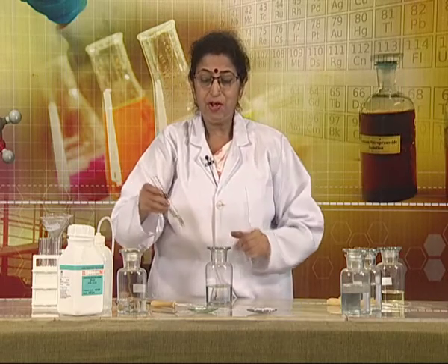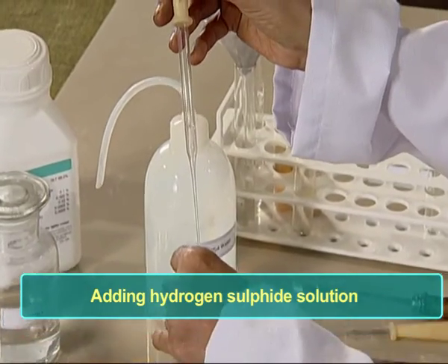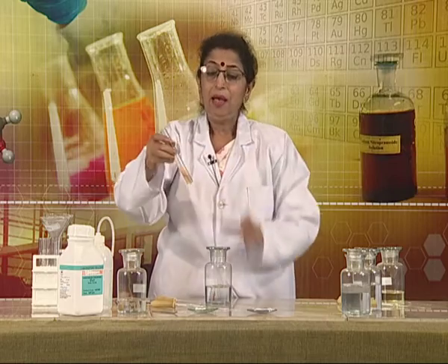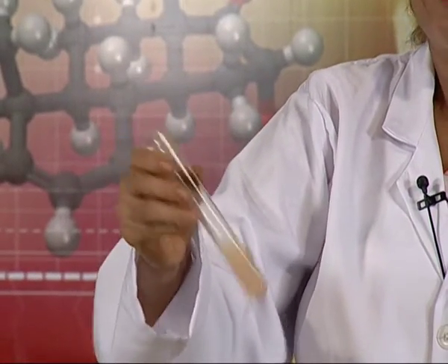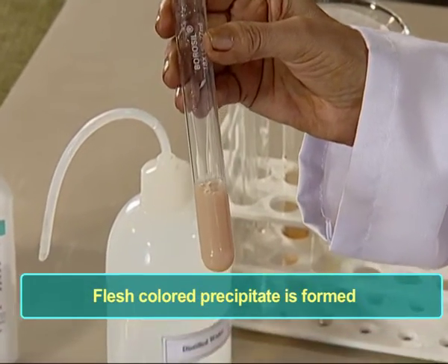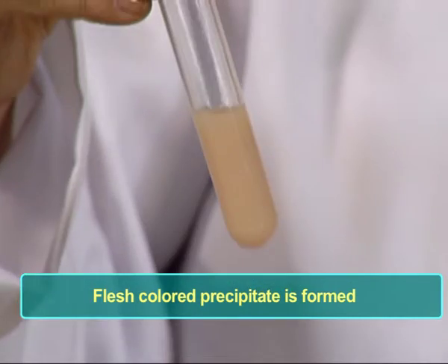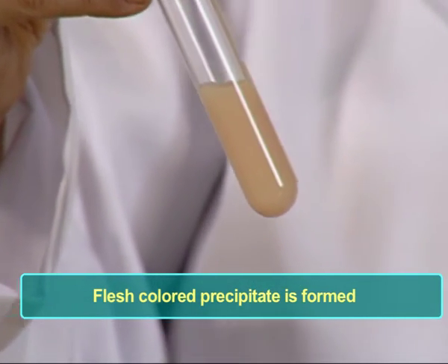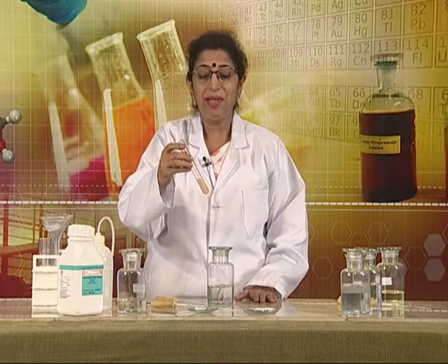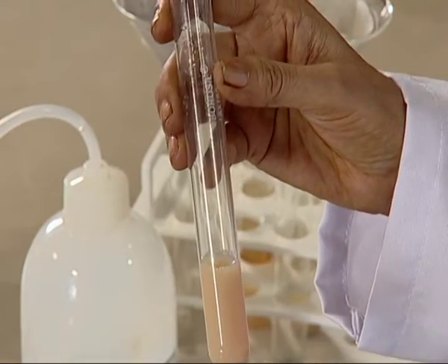Now, in this solution, we are adding hydrogen sulfide solution. A thick buff color precipitate has formed. We also call this a flesh color precipitate. This flesh color precipitate indicates the presence of manganese ions in the given salt. We will now do the confirmatory test with this precipitate, so we first filter it.